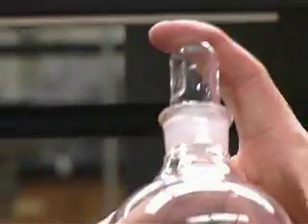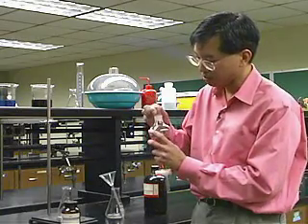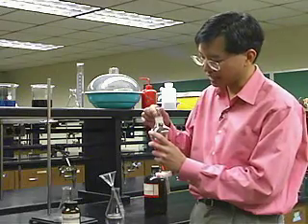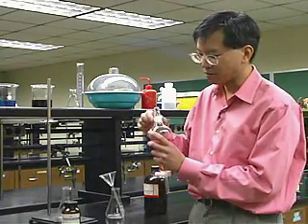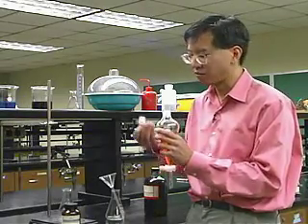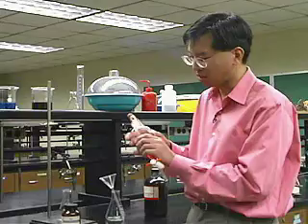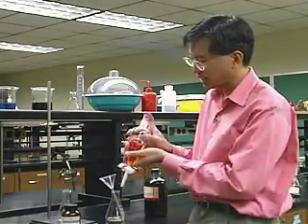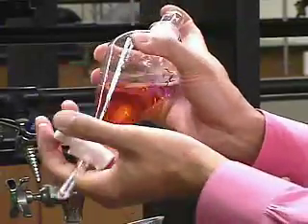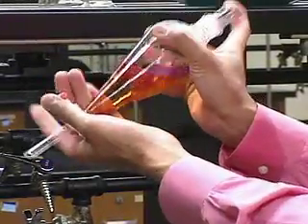Put a stopper on top and press it in tight. You can put grease on the ground glass joint, but since we're using hexane — and grease is soluble in hexane — we'd get grease into our layer, which is no good. More modern separatory funnels use a Teflon stopper instead of a glass stopper, which solves that problem. To use the sep funnel, hold the stopper with one finger, hold the body with one hand, and operate the stopcock from behind.